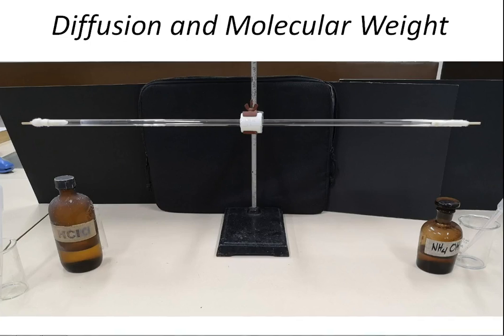If you are not able to see it, here it is. That is where the white precipitate ring formed after we have allowed your hydrochloric acid and your ammonium hydroxide to diffuse through this clear glass tube.